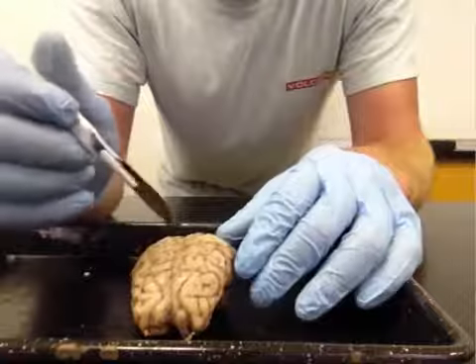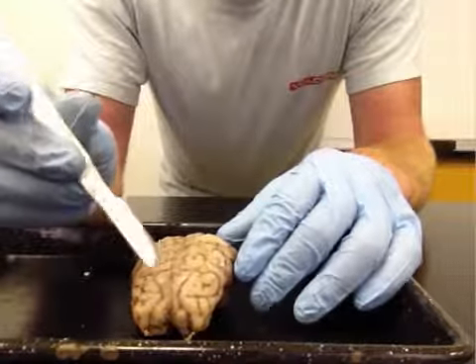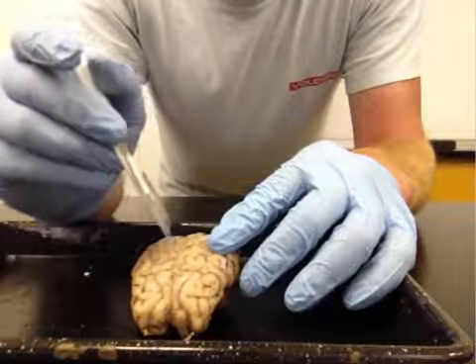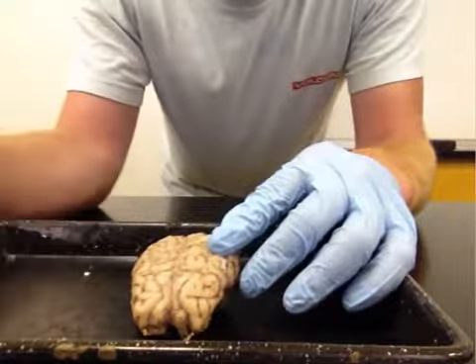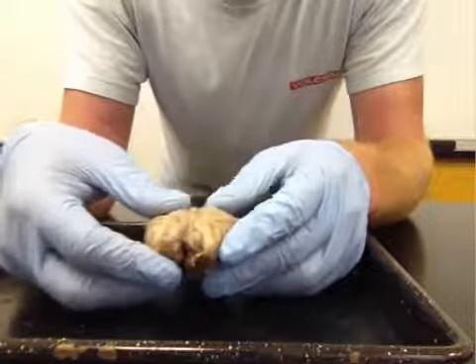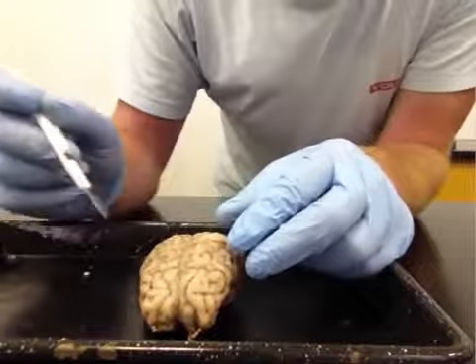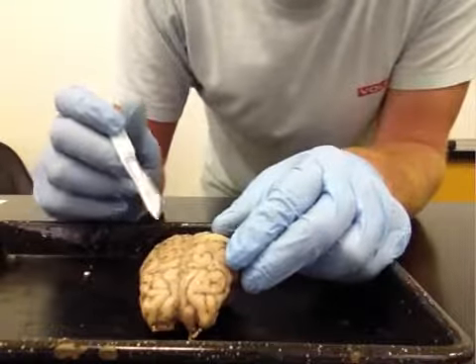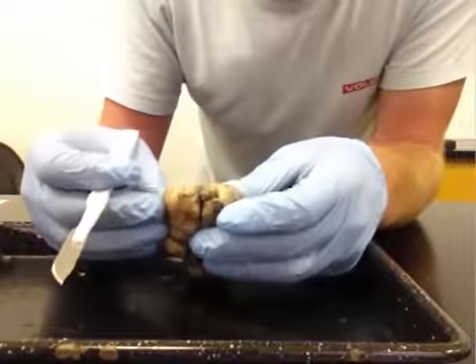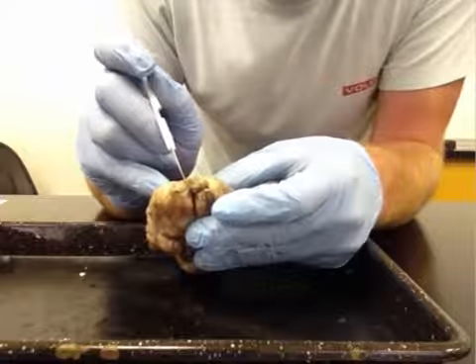So this cut, the sagittal cut, a mid-sagittal cut in particular, is going to be taking place right along the midline of the brain. So first of all, both hemispheres of the brain are connected together, and there is some meninges, particularly pia mater, the meninges that are flush with the surface of the brain that are holding the 2 sides together.